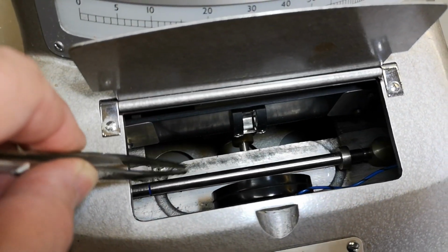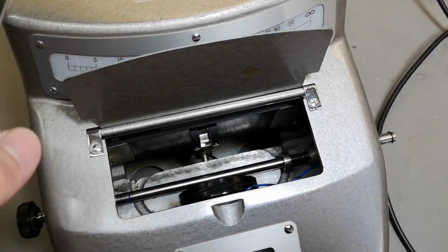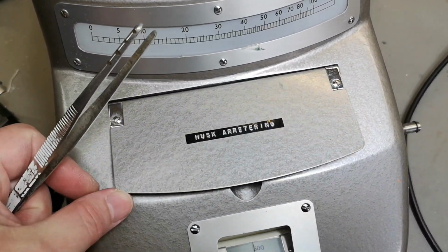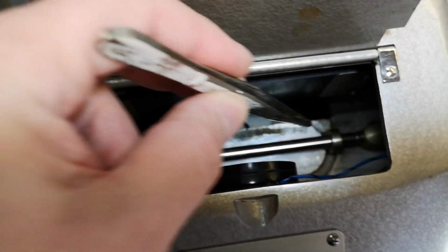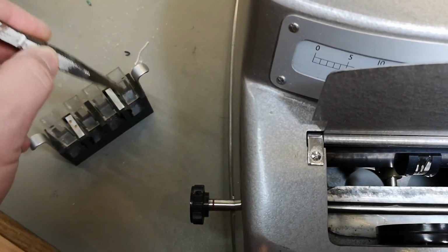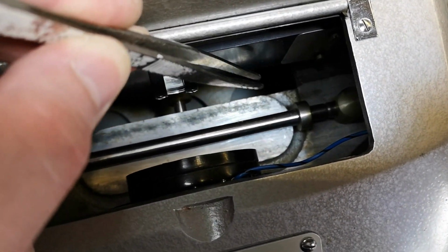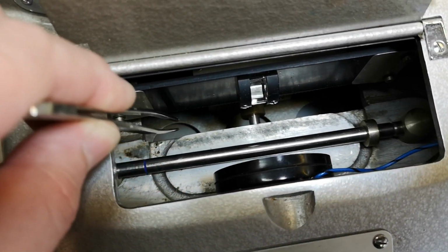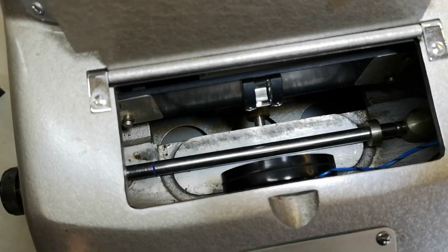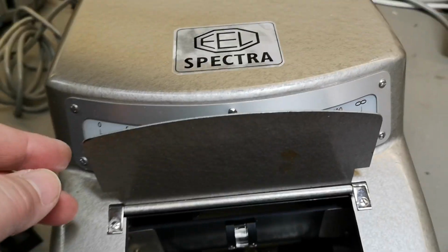I cleaned this up. It was full of all sorts of gross chemicals, including the sample tray, and this entire area here was full of super gross sticky stuff. I don't know what kind of... Is it full of DNA or something even worse? See, if you drop some chemicals, it's most likely going to follow down here and drop down the holes at the bottom. So you can just clean up your table and then you're going to be fine again. But of course this was full of sticky funny stuff.